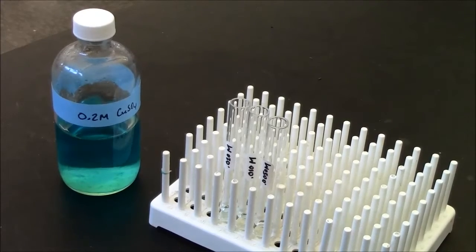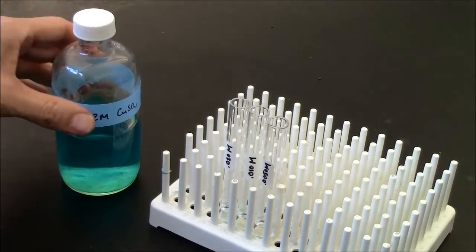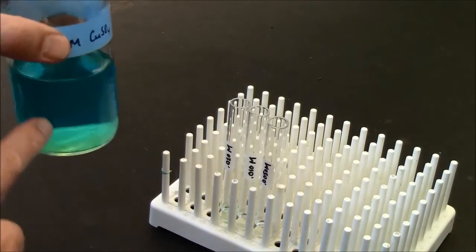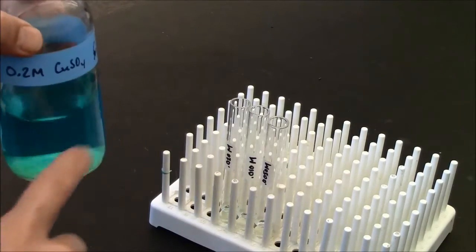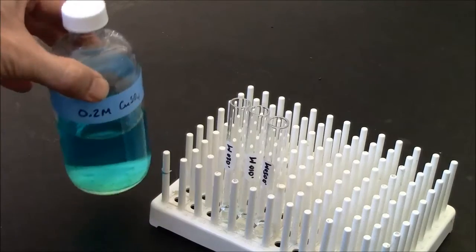Here I'm showing you a sensitive test for copper ions. Copper ions have a color in aqueous solution, and if the concentration is high enough, this is 0.2 molar, you can easily see the copper ions in solution.